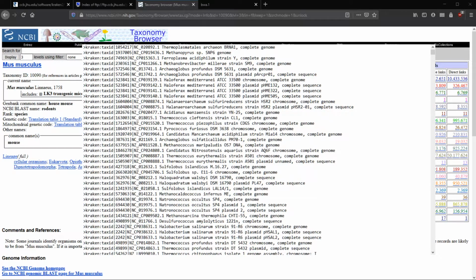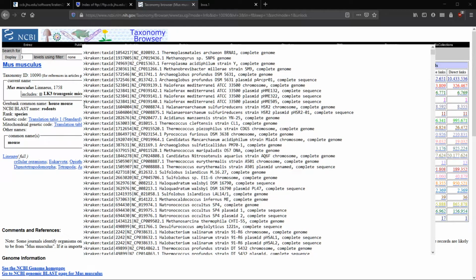Oh, and it's not going to show it. Let's just create a new line. So what we'll type is we can do Control F, so CTRL plus F. That brings up the find window, right?